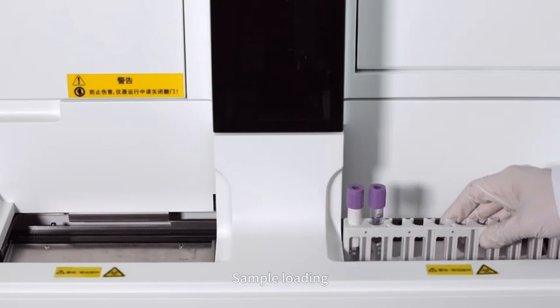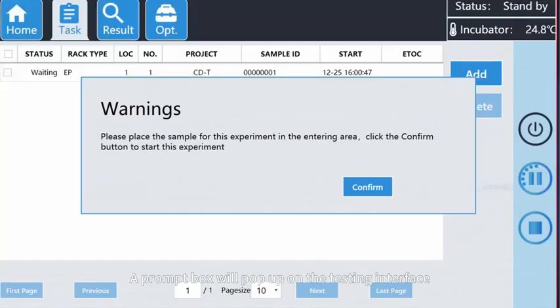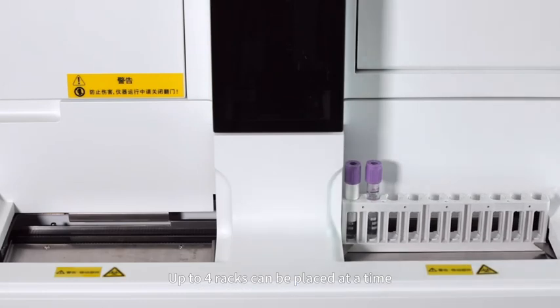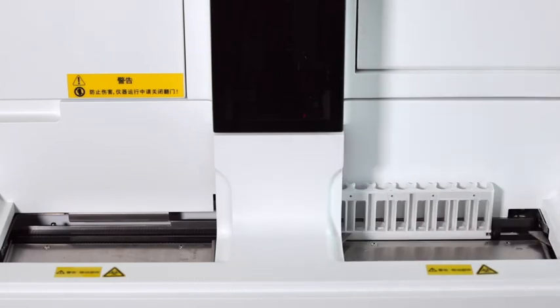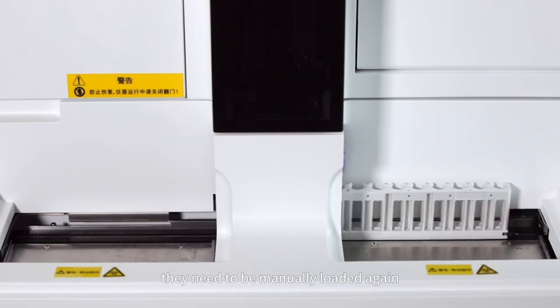6. Sample loading. After the new task is sent, place the sample rack into the device loading area. A prompt box will pop up on the testing interface. Click Confirm to start the experiment. Up to 4 racks can be placed at a time. If there are more than 4 racks, they need to be manually loaded again.